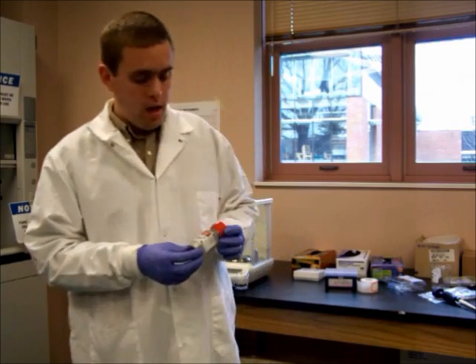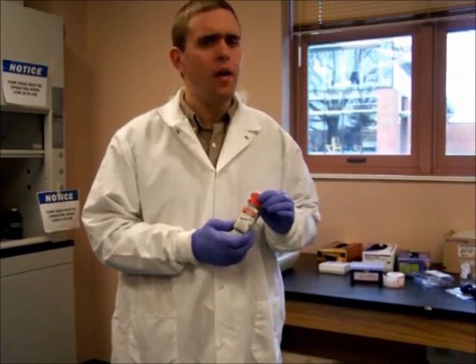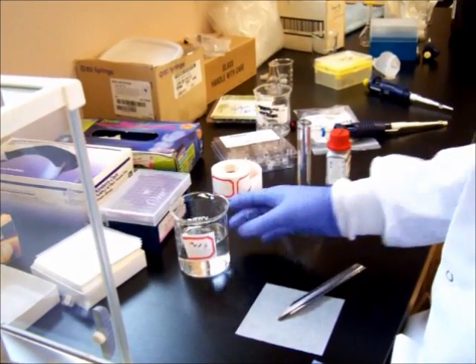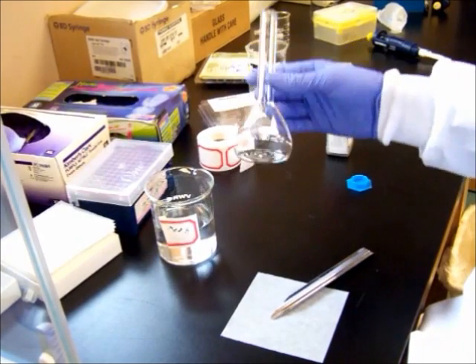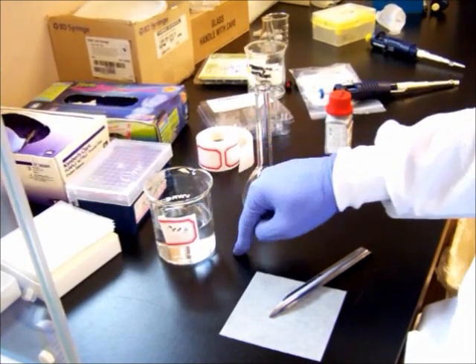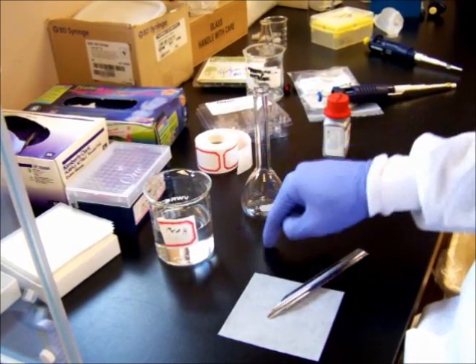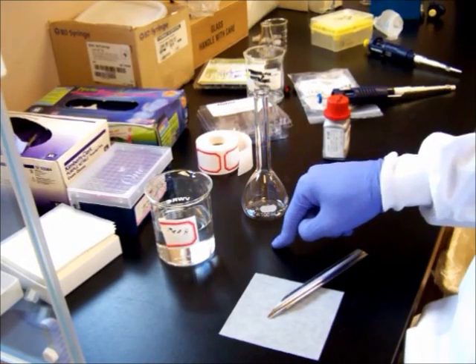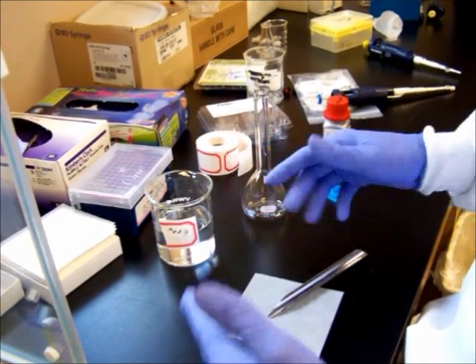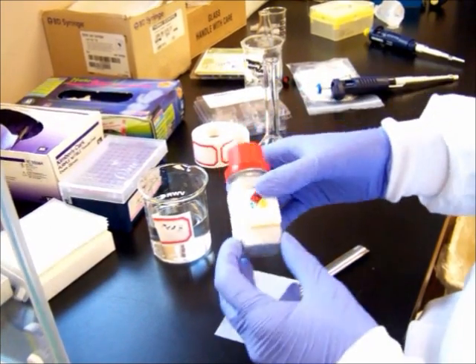For our demonstration today, we're going to be running a polyphenol through the instrument called Naringin. Before we run it, I'm going to show you how to prepare a sample of Naringin for running through it. Okay, so we have our workstation ready. We have our methanol prepared. We have a 100 milliliter volumetric flask and its lid. Now, both the flask and the beaker have been treated with a base bath, as we saw earlier. So, we know that these are extremely clean right now. Anything that goes into the instrument needs to be extremely clean, or else it's going to be there forever. Because whatever you put through the machine goes there forever. And since the machine is extremely sensitive, we need to keep everything extremely clean.